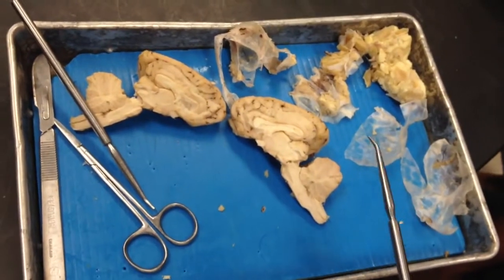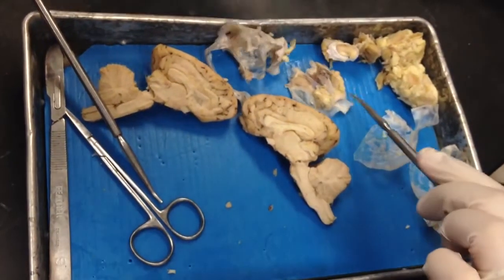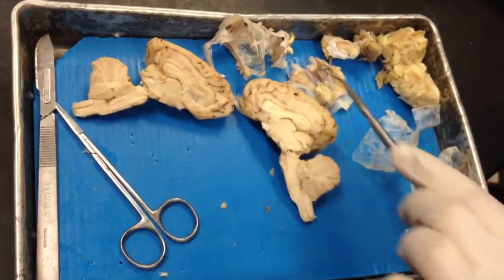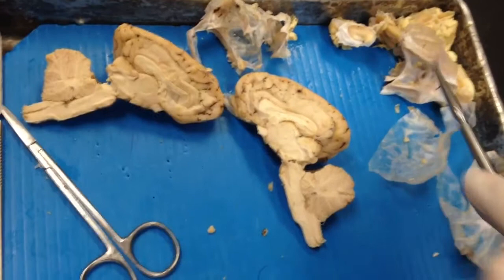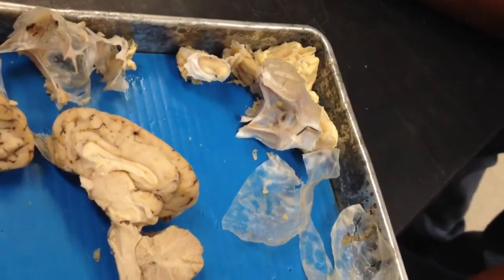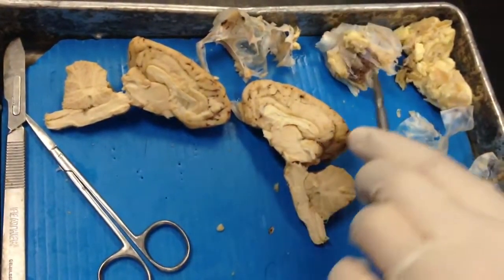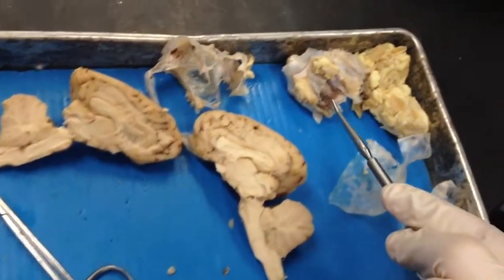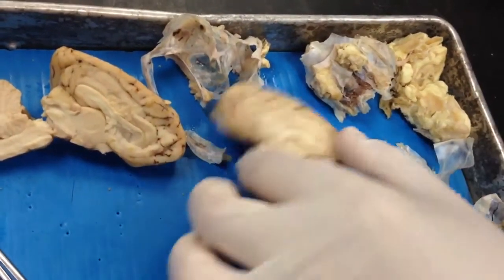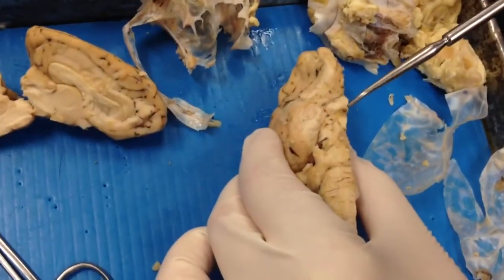Optic chiasma is right here. Optic nerve is right here. The pituitary gland came off as well but it's here and it connects right here. The infundibulum connects right here.